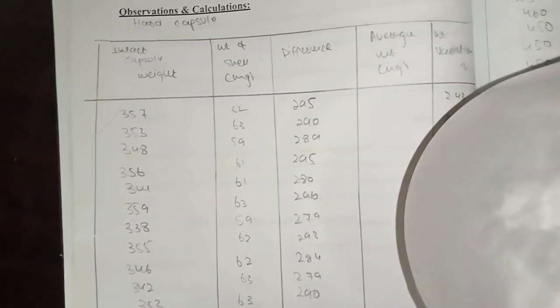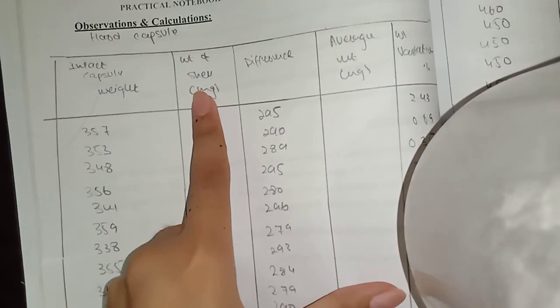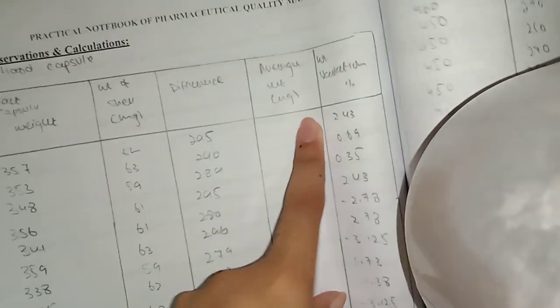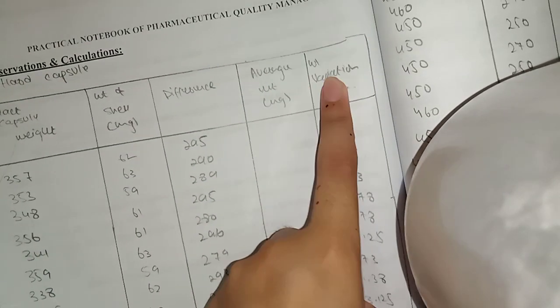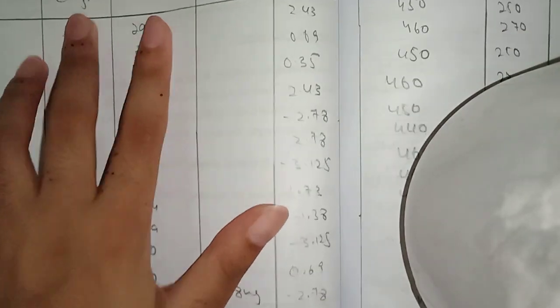You will record all observations including: intact capsule weight, shell weight, difference (content weight), average weight, and percentage weight variation. This observation table applies to hard capsules first, then soft capsules. At the end, you will have all the results compiled.